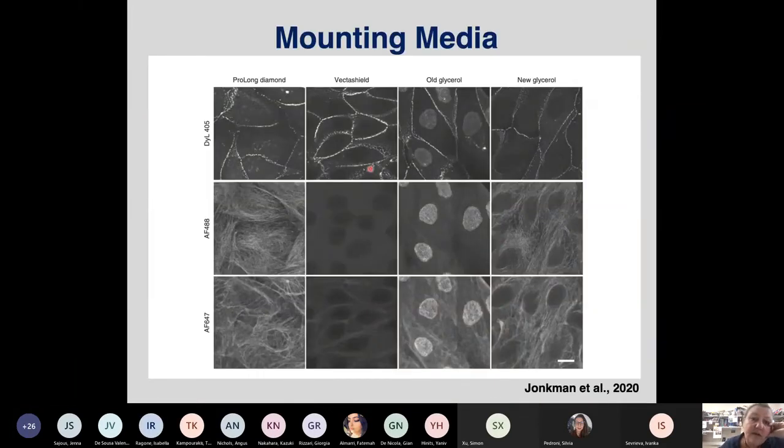So we have done all our antibody incubations, and now we are almost there at the microscope, and we are using our mounting medium and our cover slips, and almost ready to go. And there's another pitfall, because not all mounting media are good mounting media. So these guys obviously were not very successful with one. Vectashield is a commercial mounting medium that you can buy in a pot. ProLong Diamond is also something that you can buy in a pot. Now, ProLong Diamond looks pretty all right. Vectashield is obviously not something where I would either buy the pot or I would buy shares in the company.